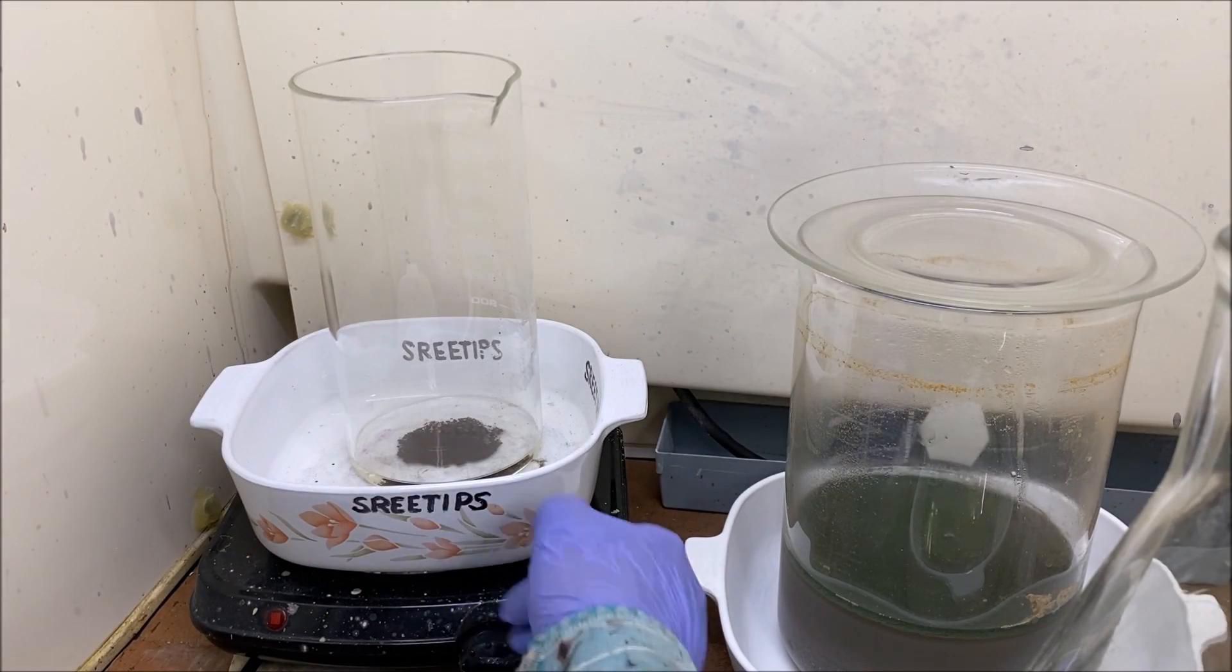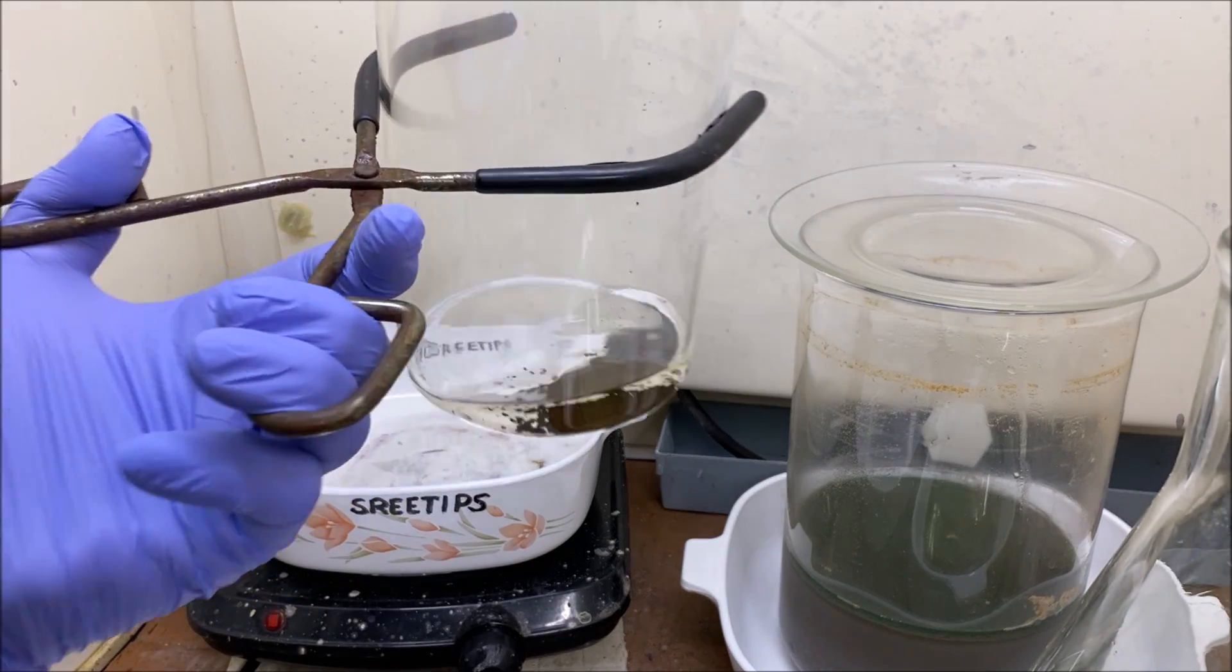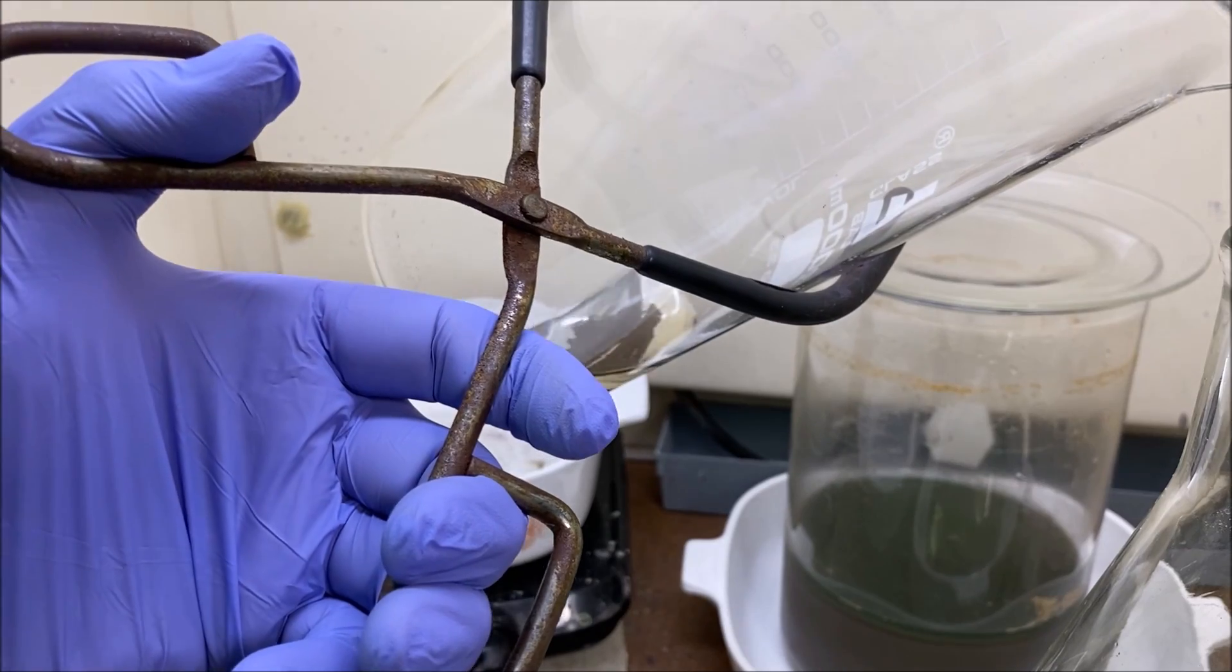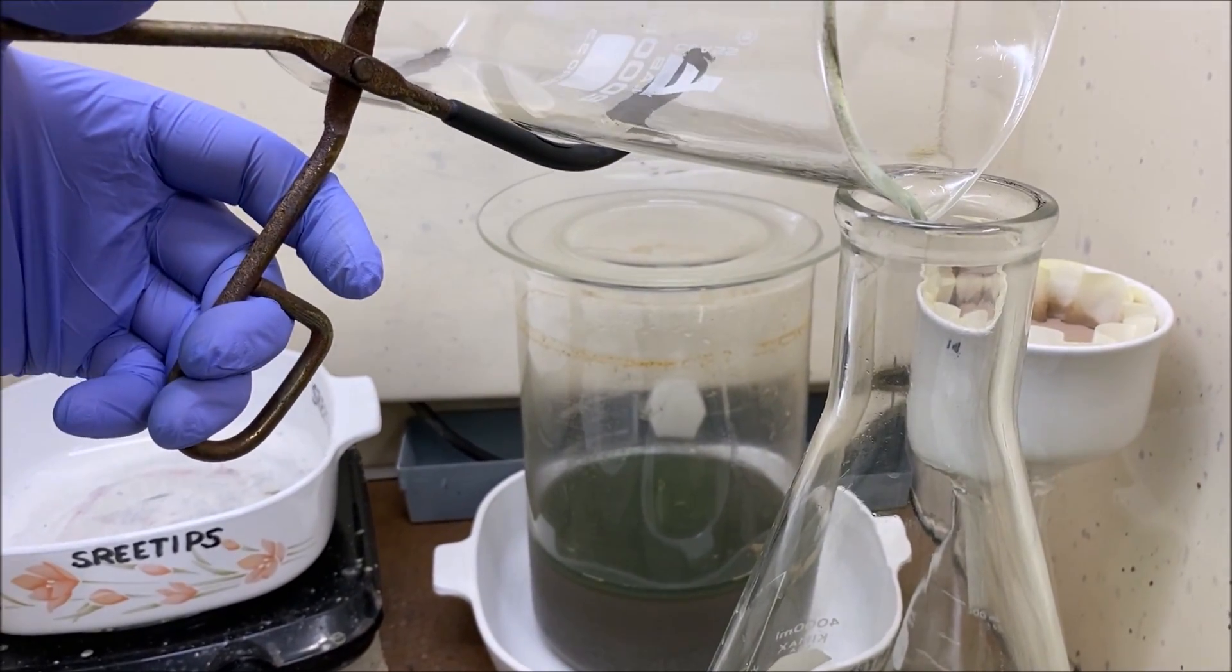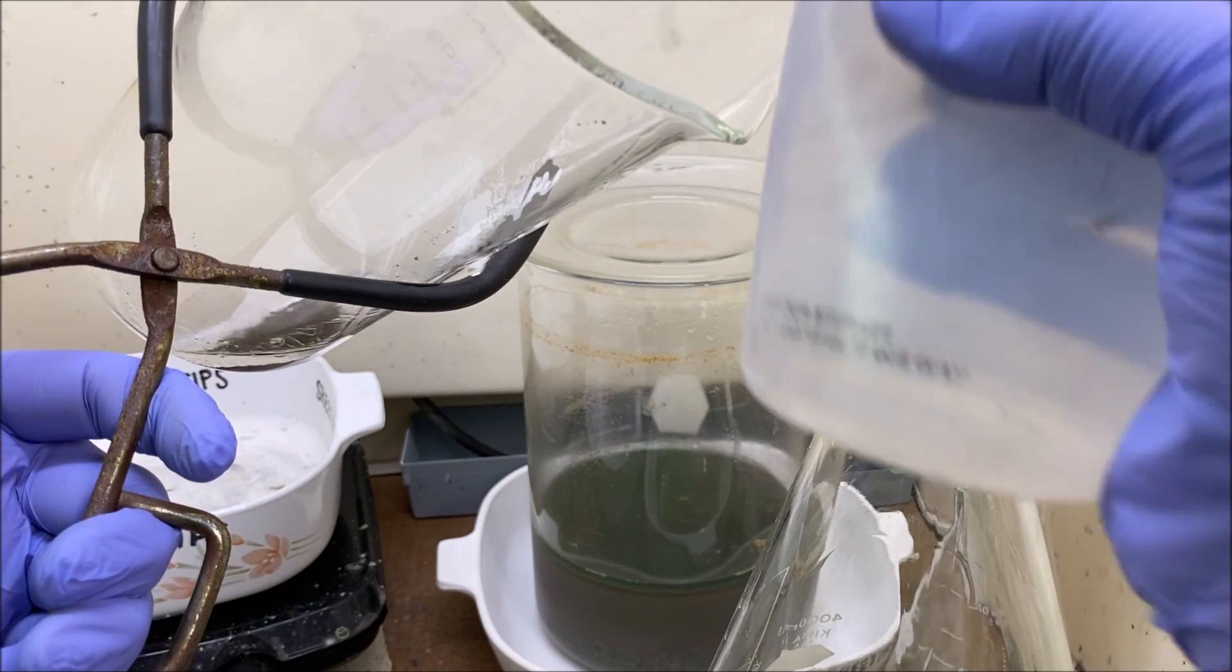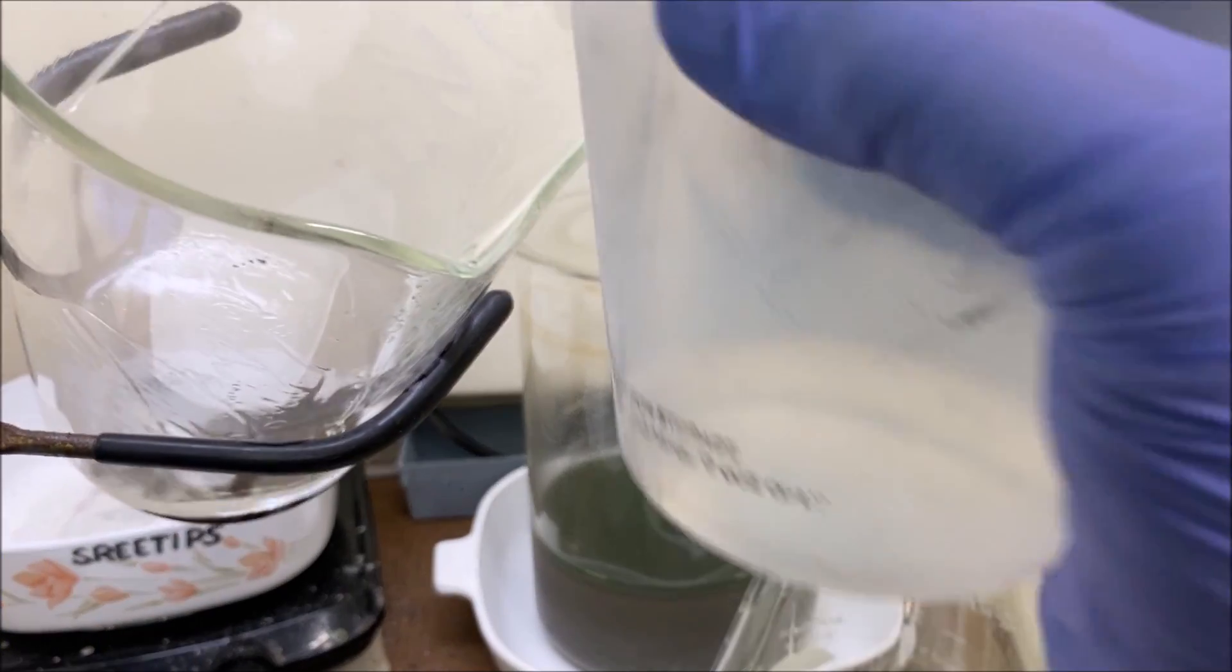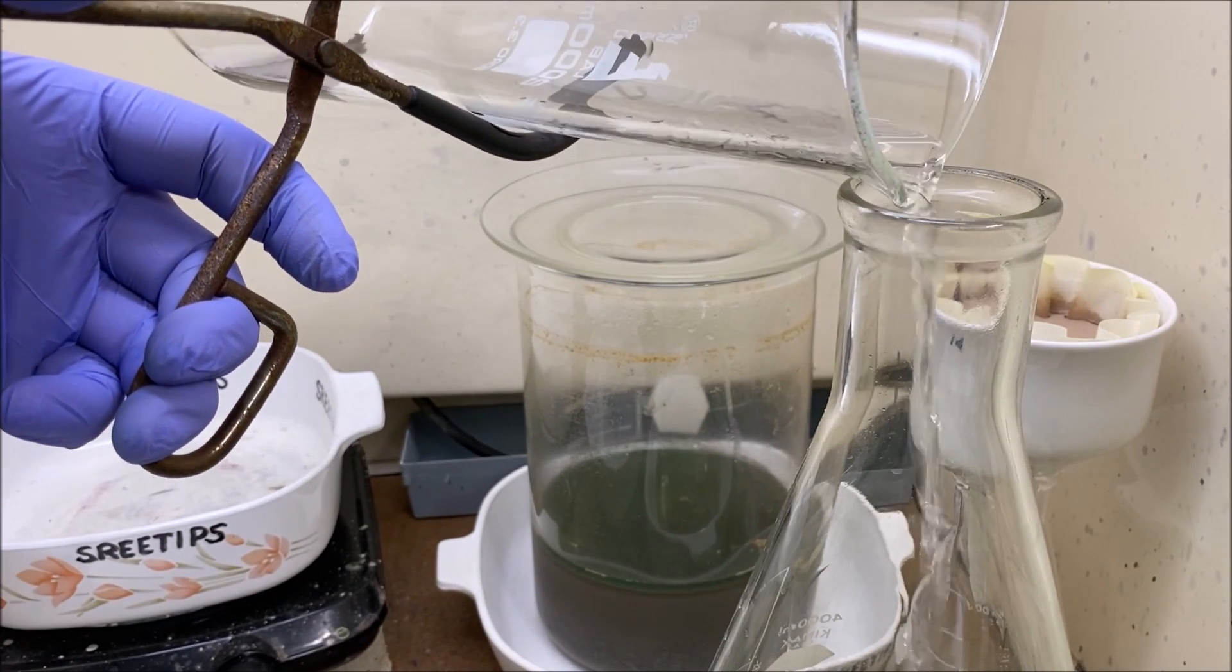Not very much gold. Give it a boil in some hydrochloric acid. I've had it in there for about 10 minutes with hydrochloric acid. Now what we'll do is pour this off into our waste container and I'm going to rinse it off with some water.